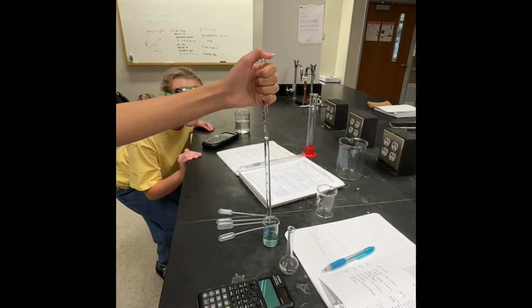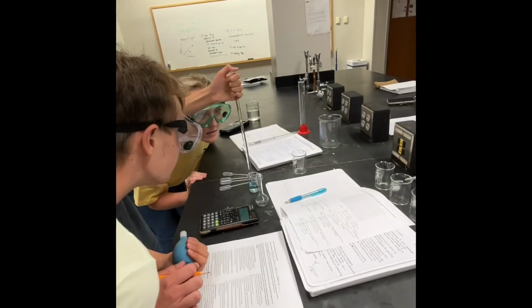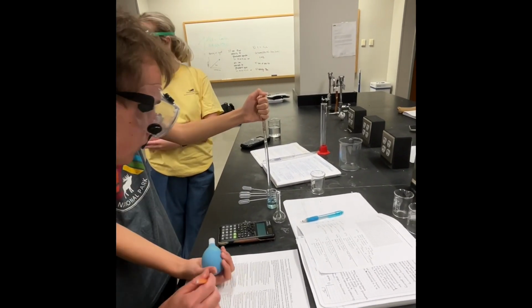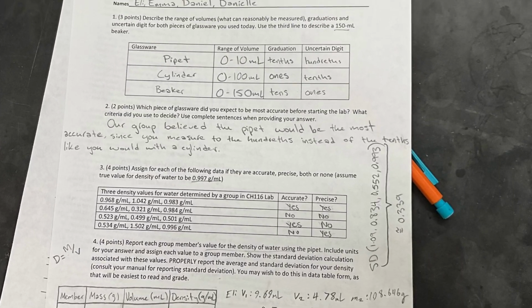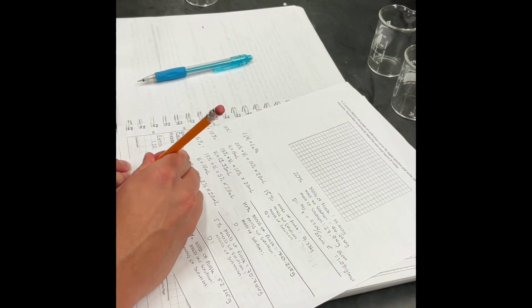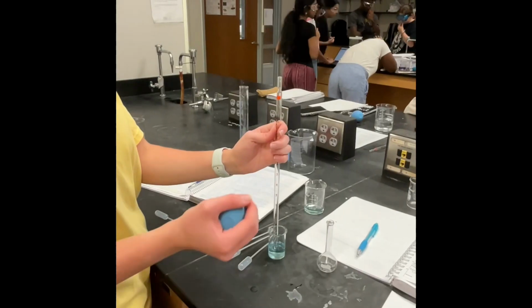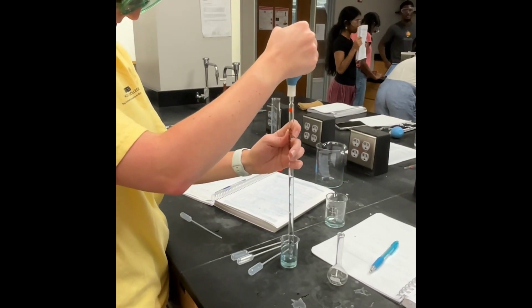Repeat the procedure of the first dilution for each concentration, 15, 10, 5, and 2%, and their predicted volumes calculated previously using the dilution equation. In total, there should be 4 dilution procedures, one for every predetermined concentration. Afterwards, using the calculated values for mass and volume, calculate density for this sugar solution, followed up with creating a graph comparing concentration on the x-axis to density on the y.